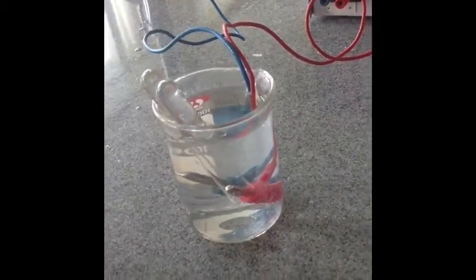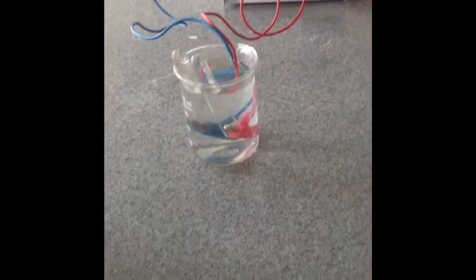We placed the two electrodes into the two test tubes, and as you can see, the blue one is negatively charged and the red one is positively charged. And now we plug in the power supply.